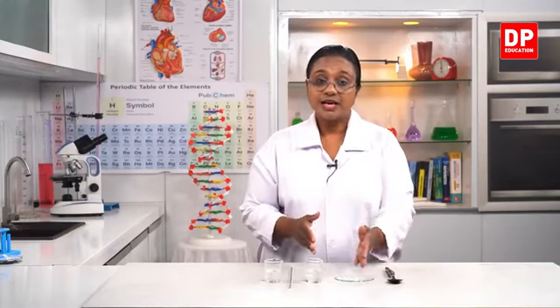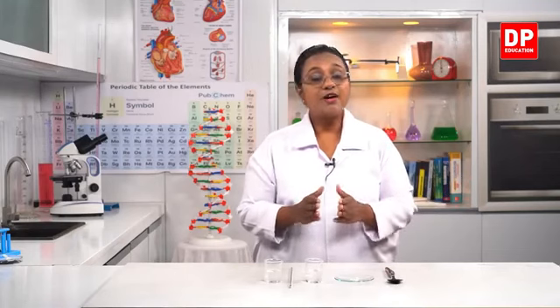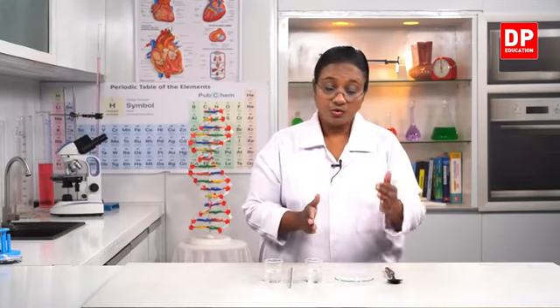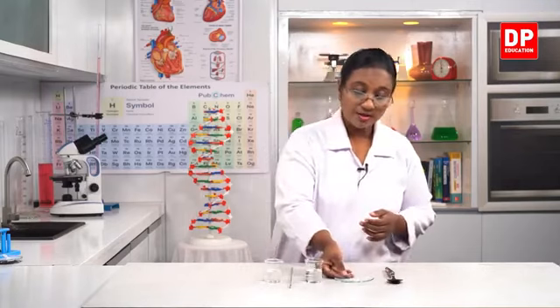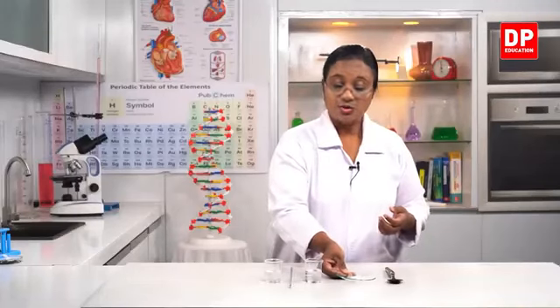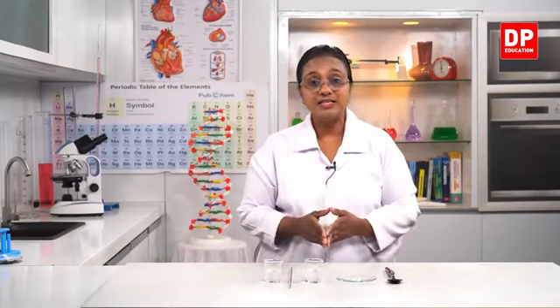Then we did the last 3 activities. Second one, I burnt magnesium in air. So, there what happened? You all can remember the magnesium strip. It was a shiny silvery metal. So, oxygen of course we cannot see, but when it burns we got this product. You all can remember observing this, the white color powder. That is the product. So, when magnesium reacts with oxygen, it forms magnesium oxide.